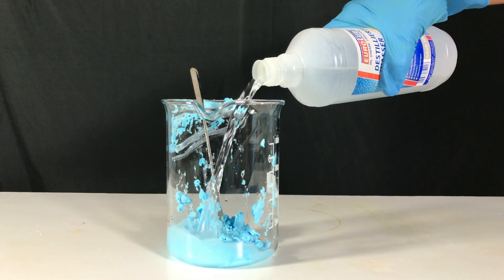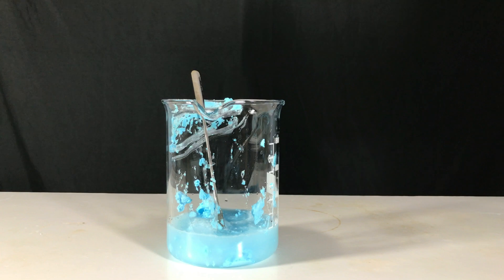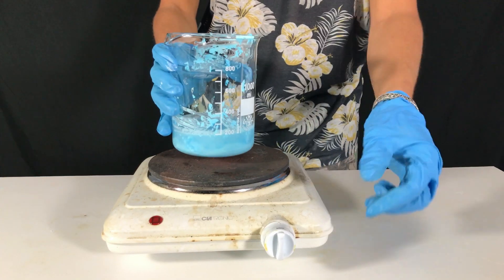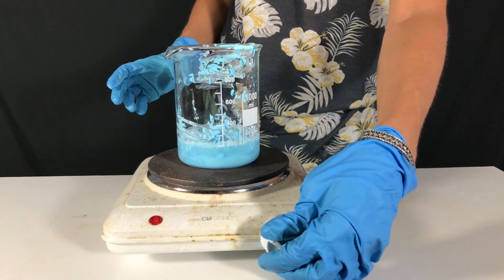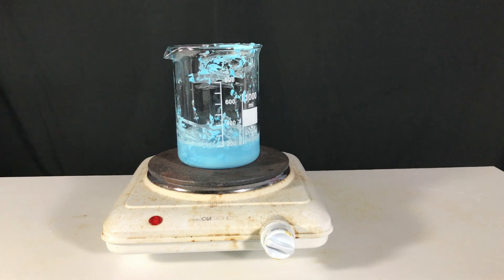Approximately 200 milliliters of distilled water were added. We put the beaker on top of a hot plate and stir up everything using a glass stir rod.